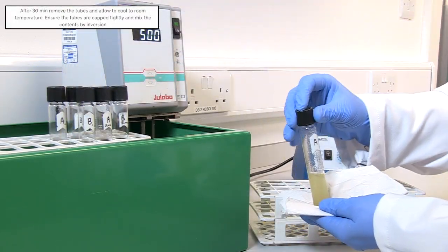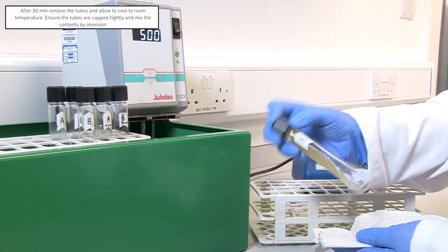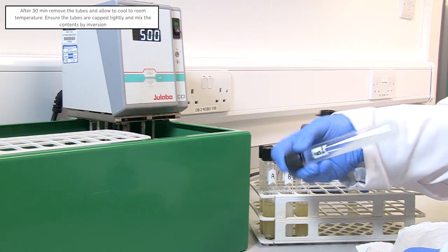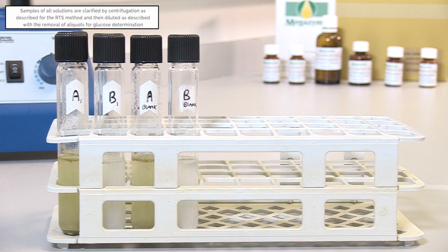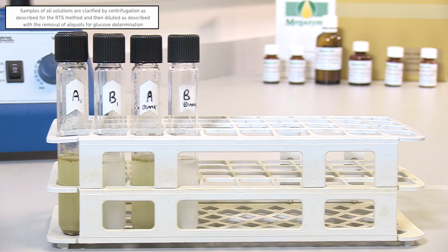After 30 minutes, remove the tubes and allow to cool to room temperature. Ensure the tubes are capped tightly and mix the contents by inversion. Samples of all solutions are clarified by centrifugation as described for the RTS method, and then diluted as described with the removal of aliquots for glucose determination.